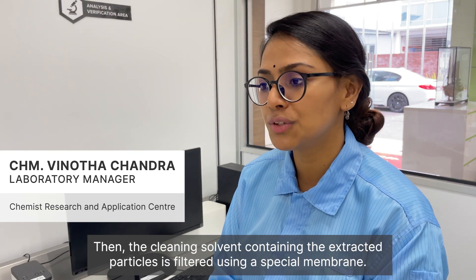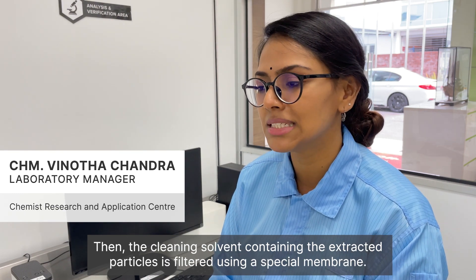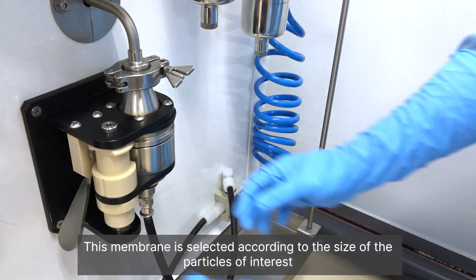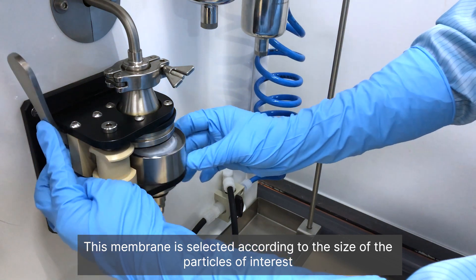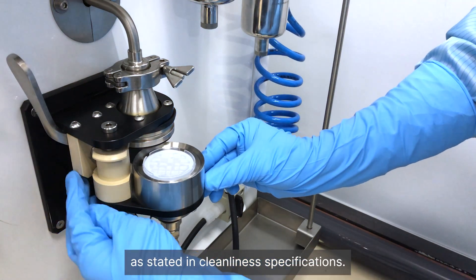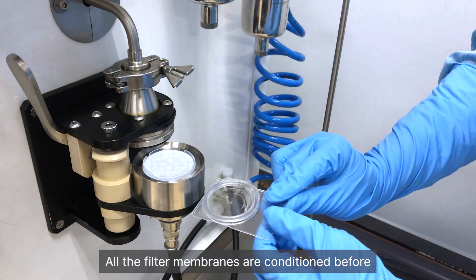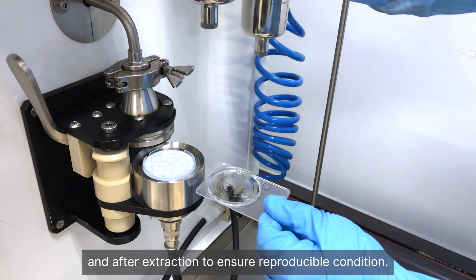Then the cleaning solvent containing the extracted particles is filtered using a special membrane. This membrane is selected according to the size of particles of interest as stated in the cleanliness specification. All filter membranes are conditioned before and after extraction to ensure reproducible conditions.